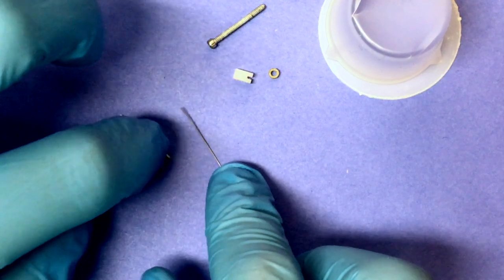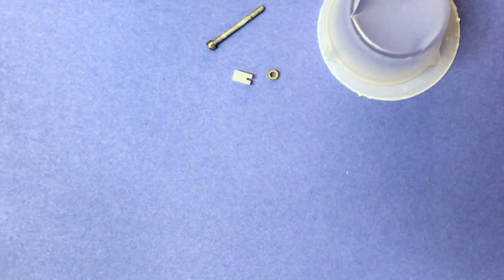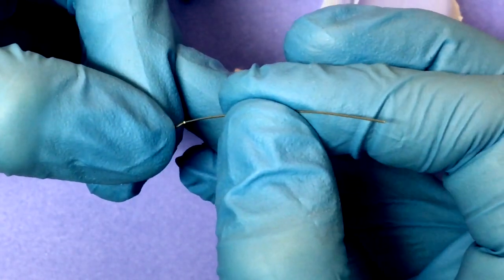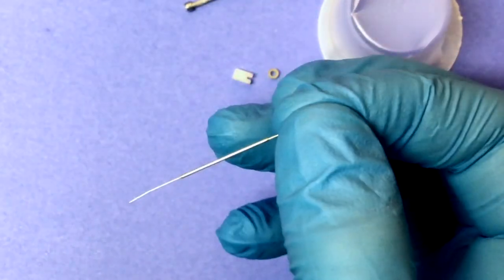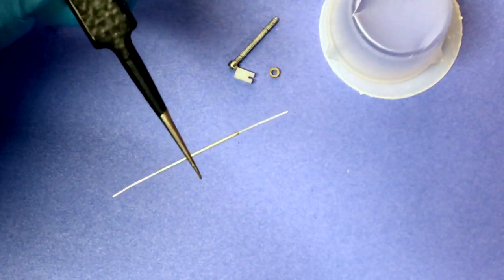Your next step will be to take the 23 gauge cannula and not only run music wire through it to ensure that it is not blocked, but you'll also want to run a 30 gauge cannula through it. This will ensure that later on, when the Tetrode carrier is made and being screwed down onto a 30 gauge, you are totally sure it is not blocked in any way.